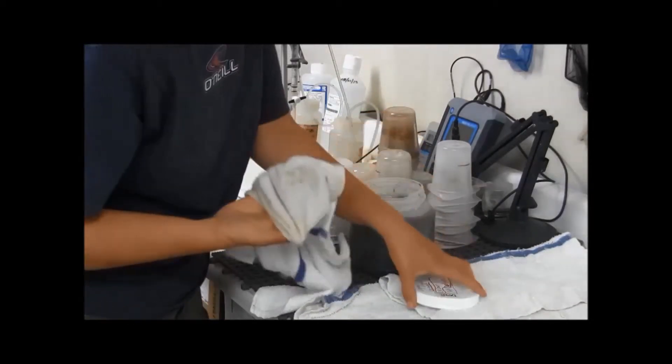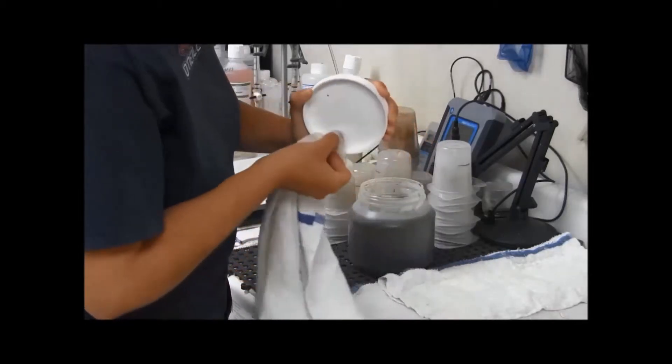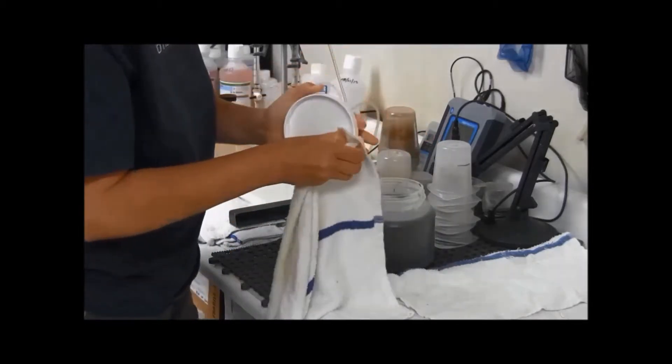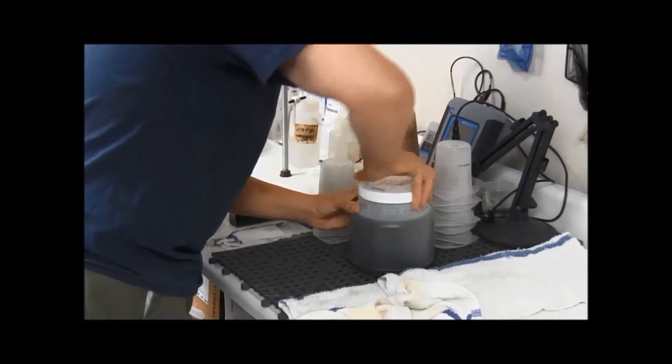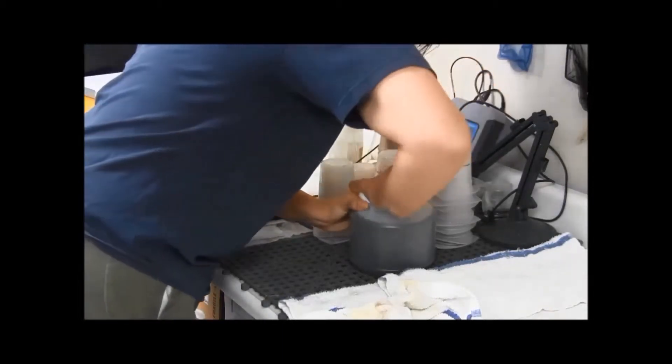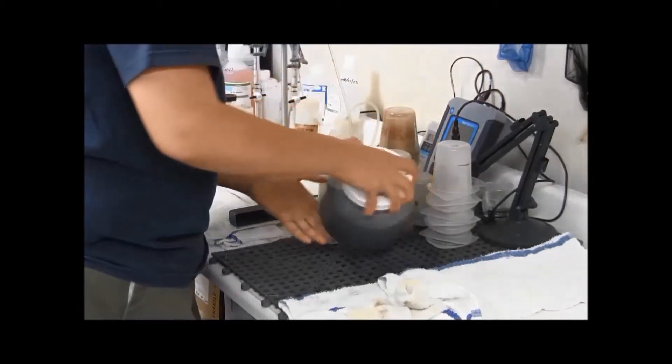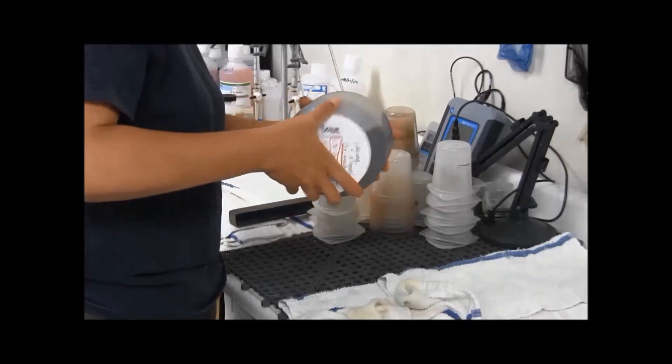You tighten this up. You're going to want to mix it around a little bit until you see all the air bubbles from the bottom to make sure that all the sediment gets all preserved enough. And you don't have anything really caked at the bottom.